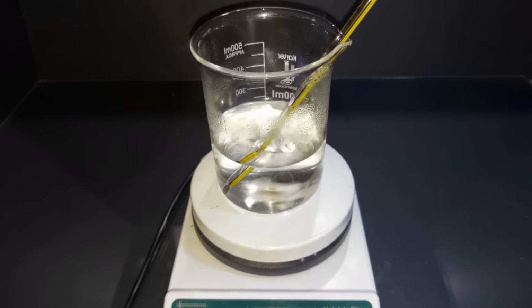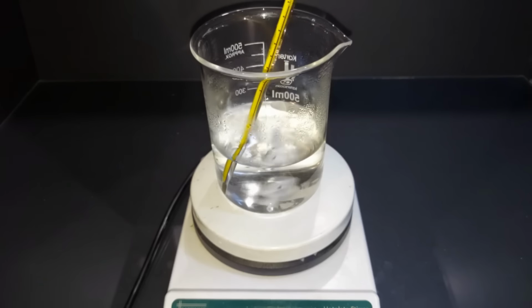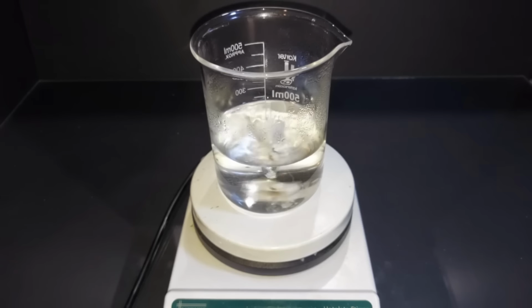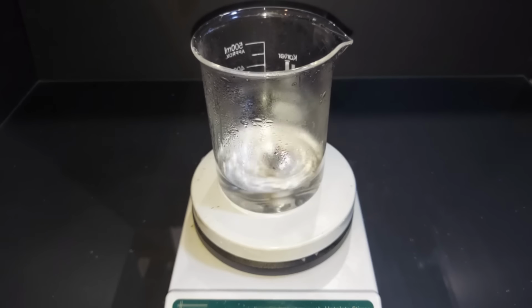The temperature started to come down on its own. It's down to 63 degrees Celsius or thereabout. So the reaction's completed. I'm going to now start to heat it. We are at approximately 100 milliliters here, and because it's pretty hot, it was at around 80 degrees Celsius most of the time. Even if I turn the heat off now, it's probably going to drop below 100 there as it cools down. But I'm going to let this cool down to room temperature.